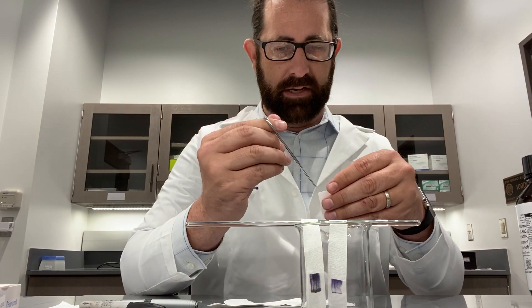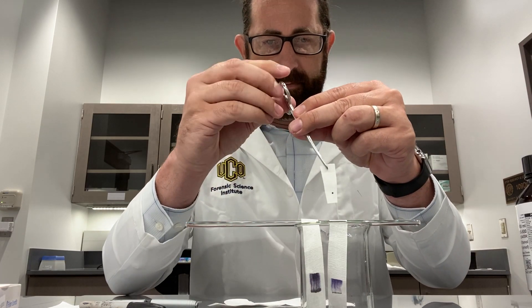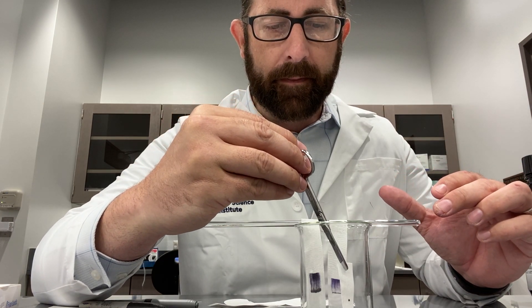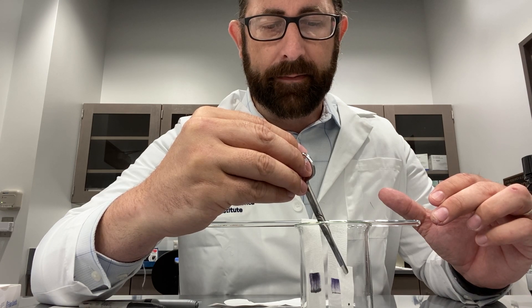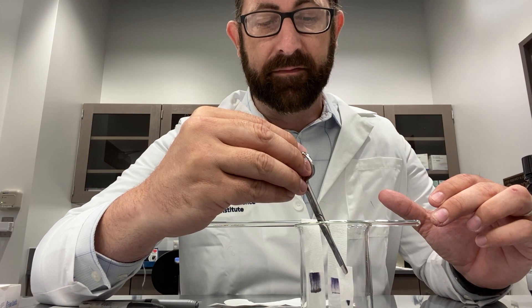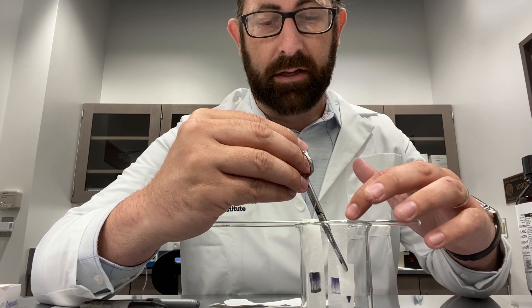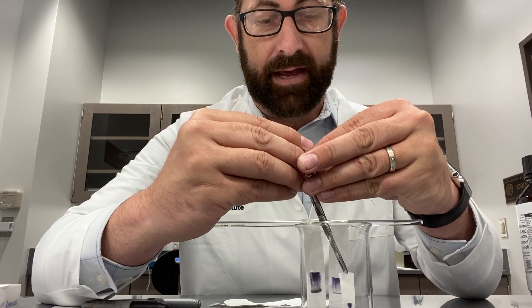Let's see if I can hold that on there and place that. Now, you really wouldn't want to hold your experiment the entire time. But what we're doing is letting this go up into the filter paper. I'm going to try to set it down close — watch this fall. If it falls, you're all allowed to laugh.